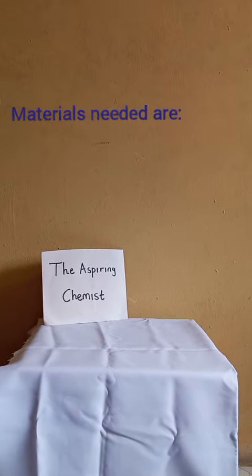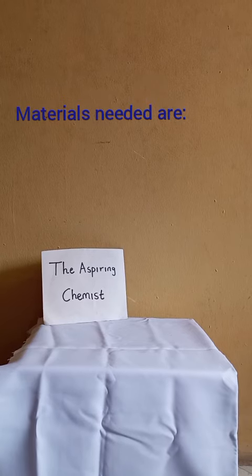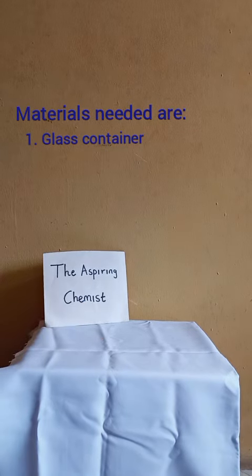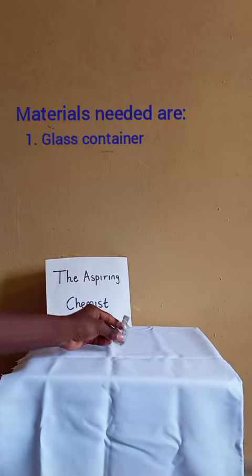First of all, you need a case. I'll suggest a glass casing, and I've gotten this nail polish bottle I found around, so I washed it and I ended up with this container.